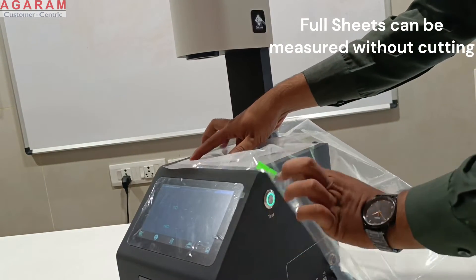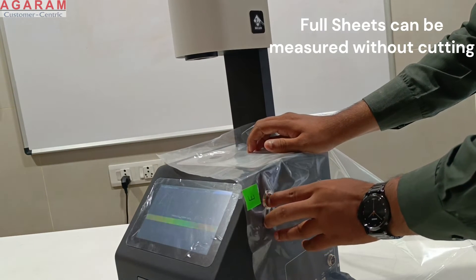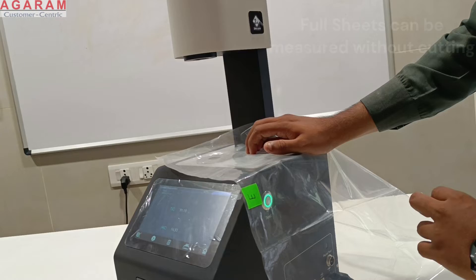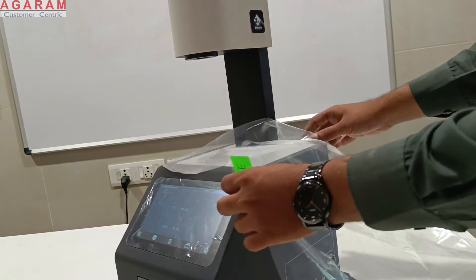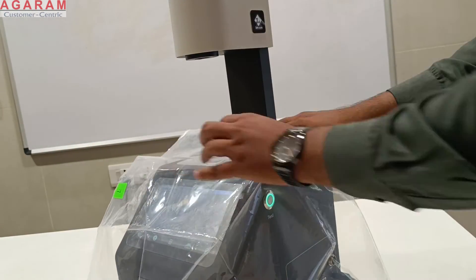Instead of cutting the samples, full sheets can be placed directly on the measuring port. Always ensure flatness of the sample over the port.